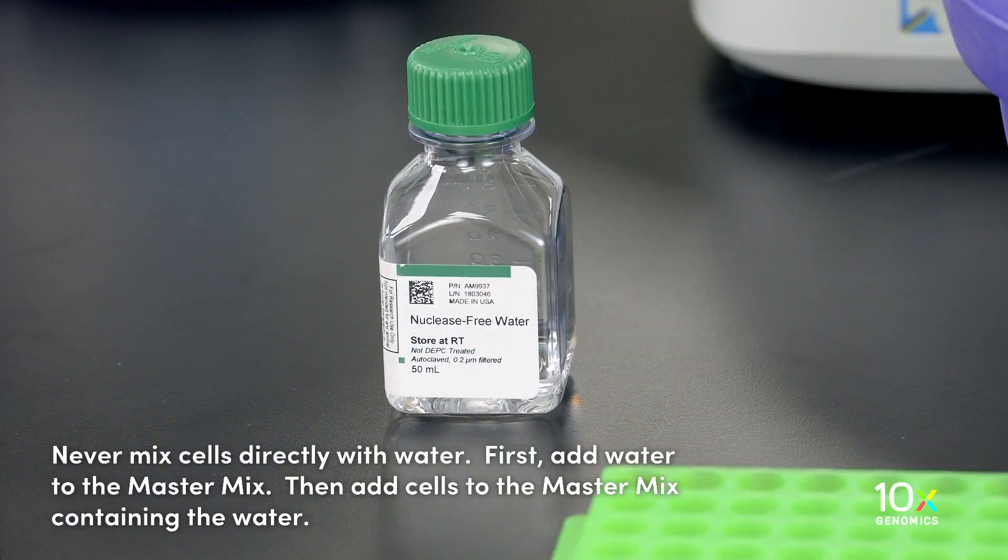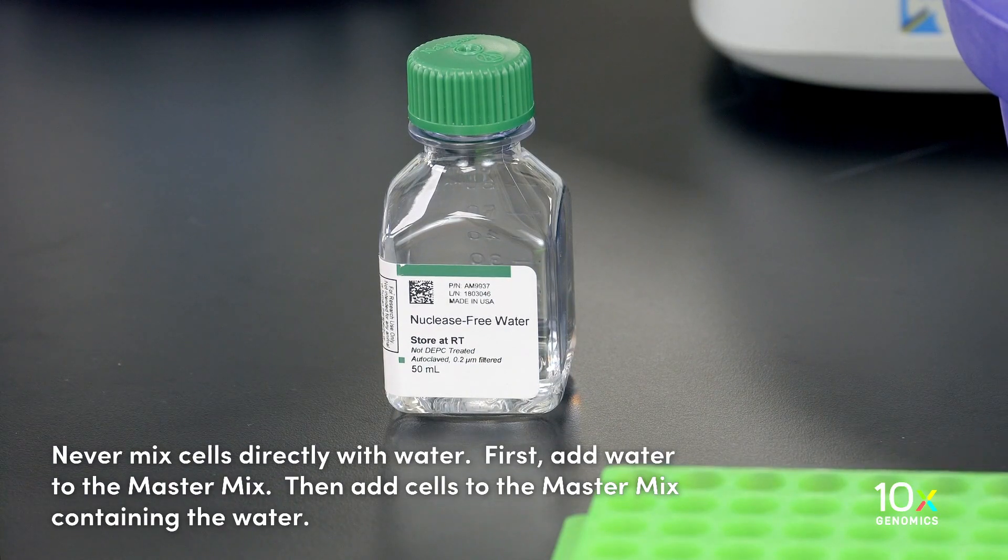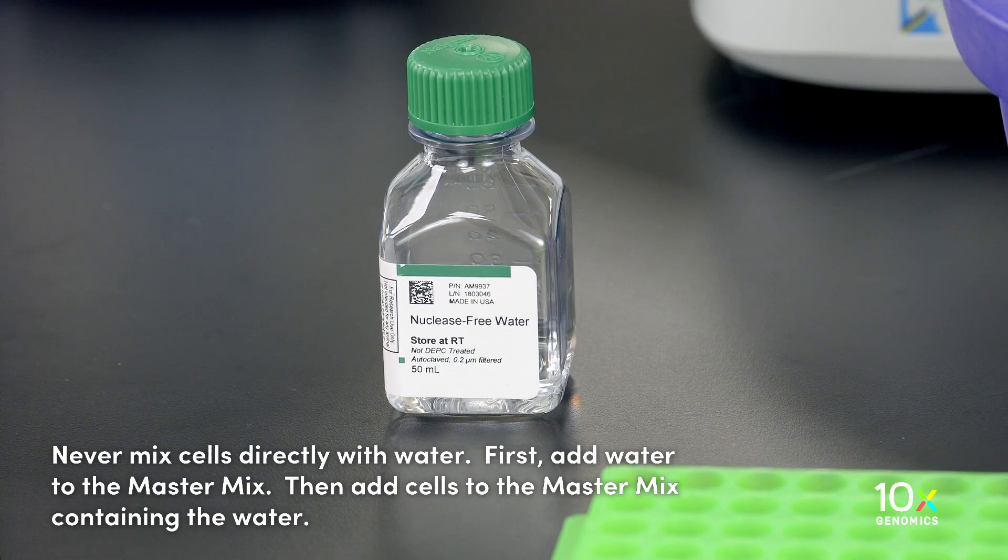Never mix cells directly with water. First add water to the master mix. Then add cells to the master mix containing the water.